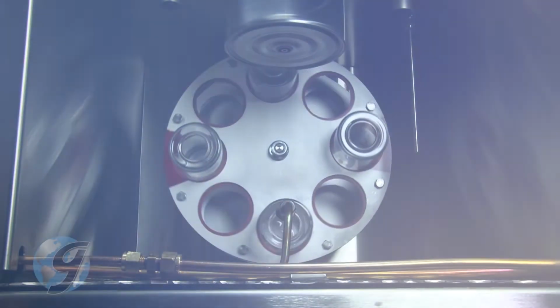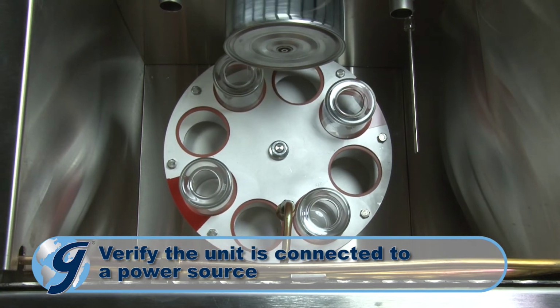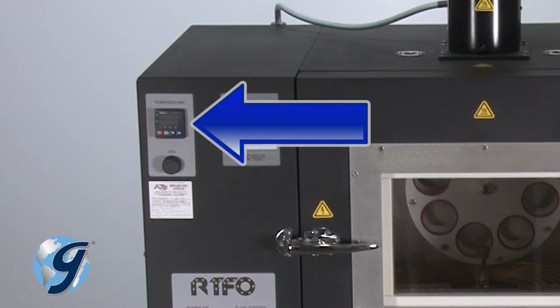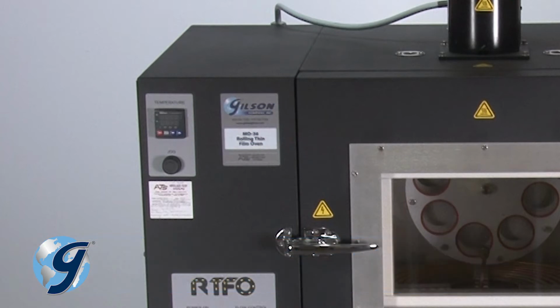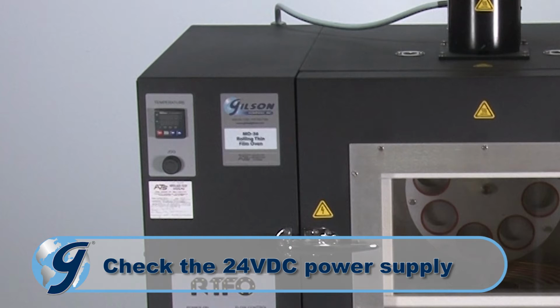If the unit will not heat, verify that the unit is connected to a working power source. If the unit still will not heat, check the temperature controller located on the front panel of the unit to verify that it is turned on and that the SV temperature is higher than the PV temperature. If the unit still will not heat or the temperature controller will not turn on, you need to check the 24-volt DC power supply.